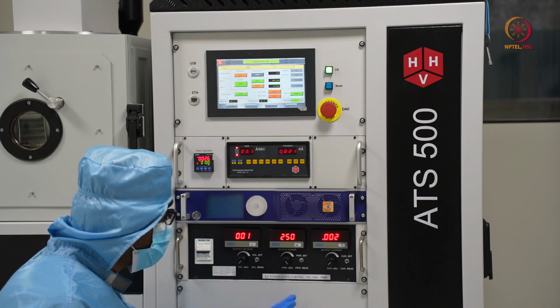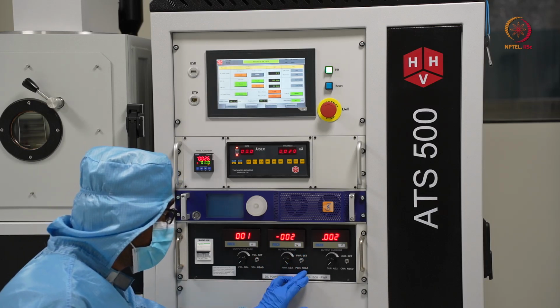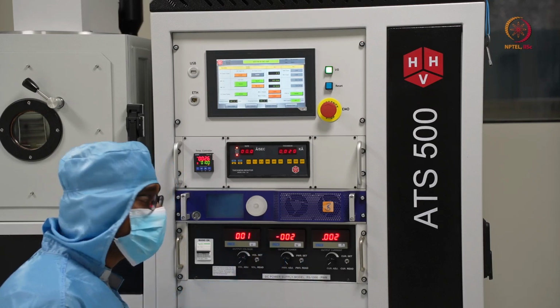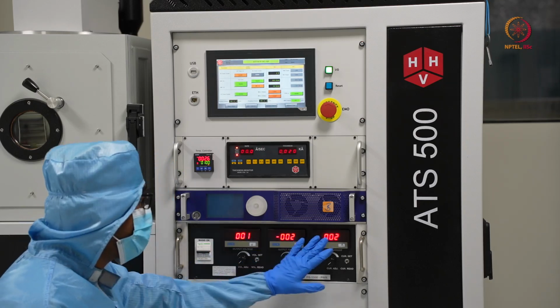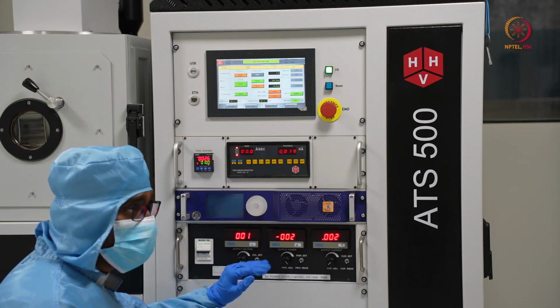So let's say we set it at 250 and put it as power read power. So read power means actually how much is getting delivered, and set power is the maximum how much it will be delivered. So let's say if we maintain it in such a way that V and I is so high that it will cross 250, then it will be like one cutoff.